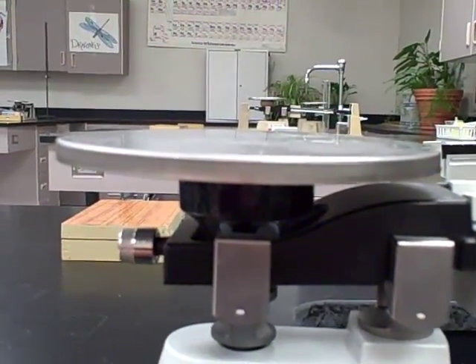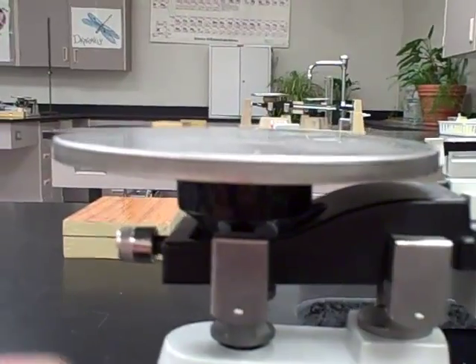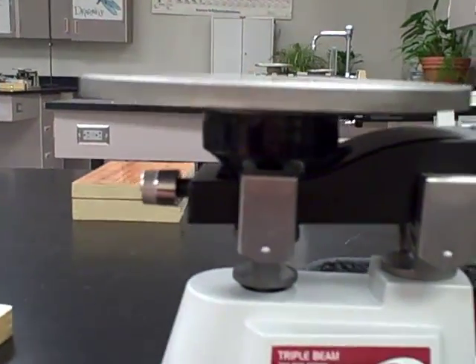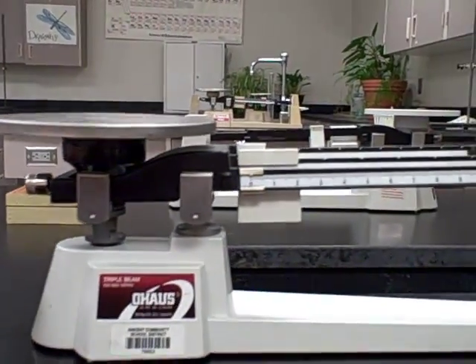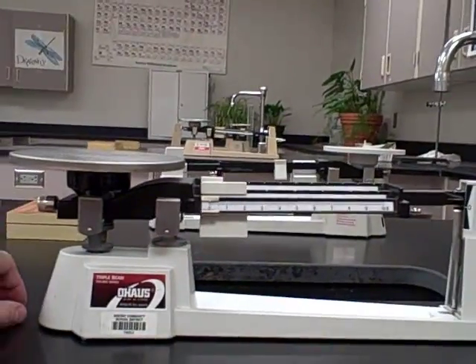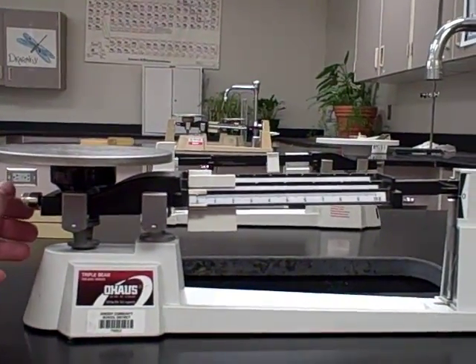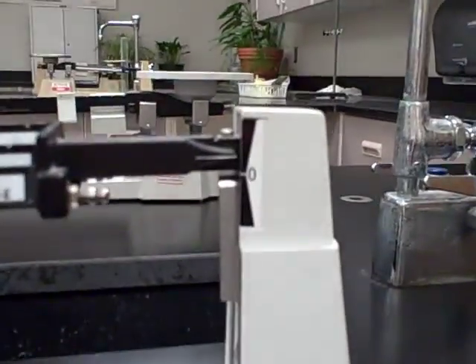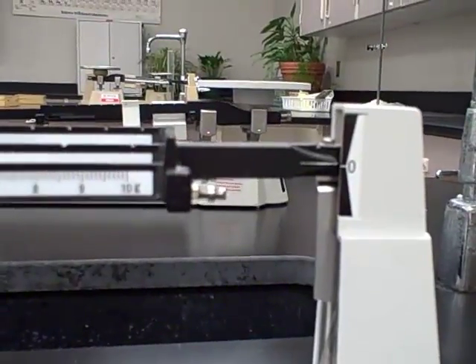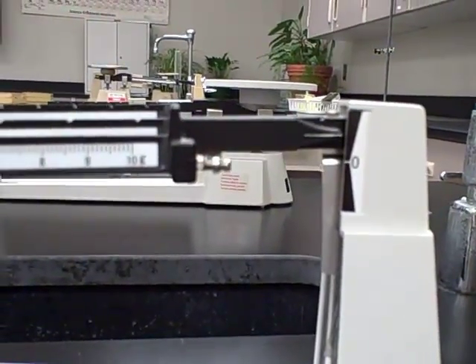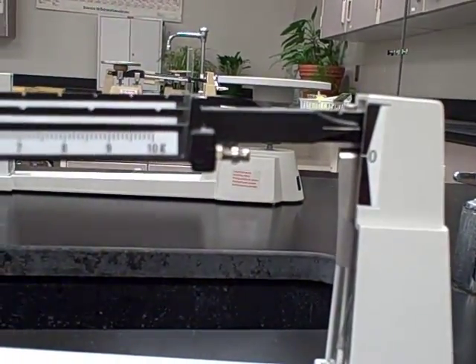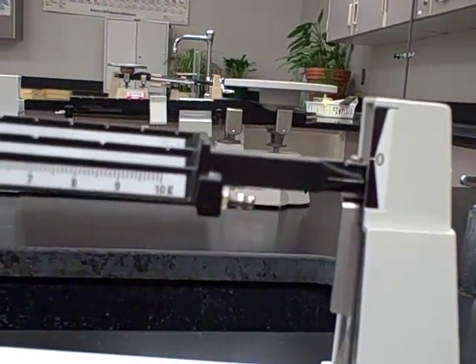If you rotate to the left or counterclockwise, it's going to push it out and shift weight to the left. You just decide what you need to do. If you can't think of it, just guess and see what happens to your needle on your mark over here. I'm going to do a righty-tighty to shift some weight over to the right side and help that right side come down a bit.